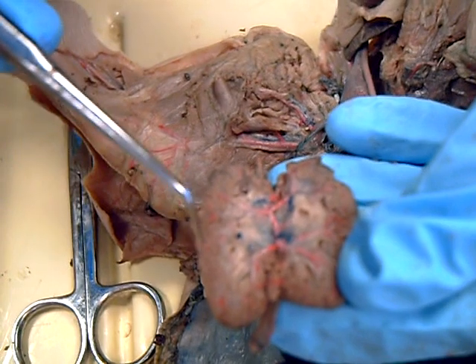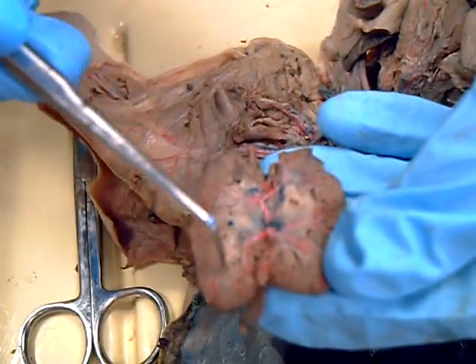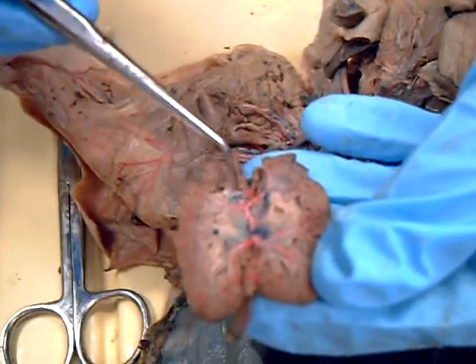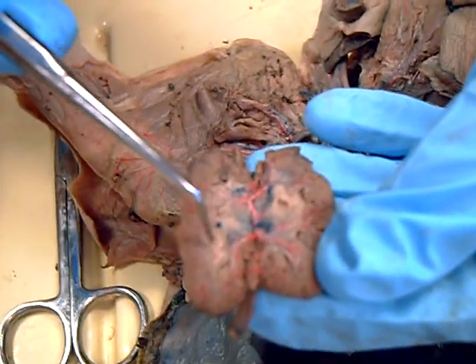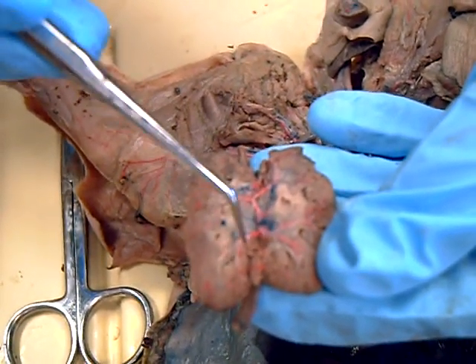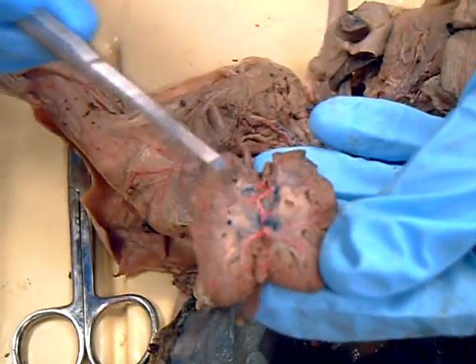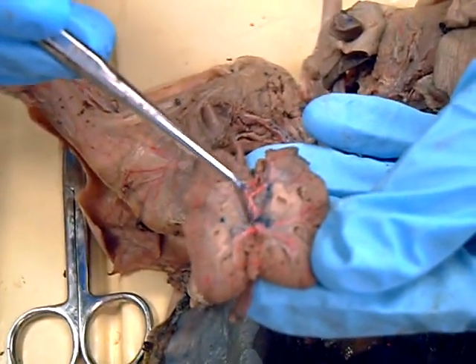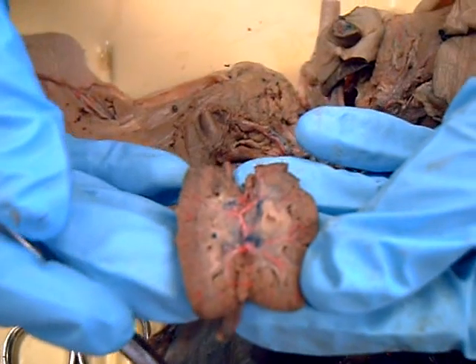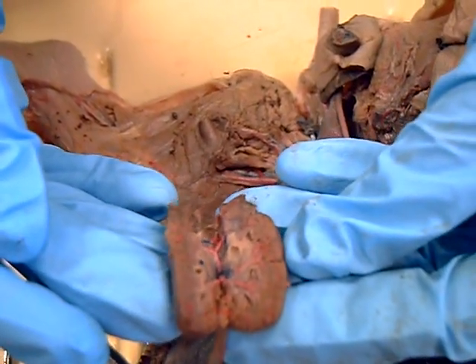The outer area here is renal cortex. This whole inner area where those pyramids are is the medulla. And those pyramids are going to drain into the renal pelvis. The renal pelvis is going to be continuous with the ureters, and take the urine down to the bladder.